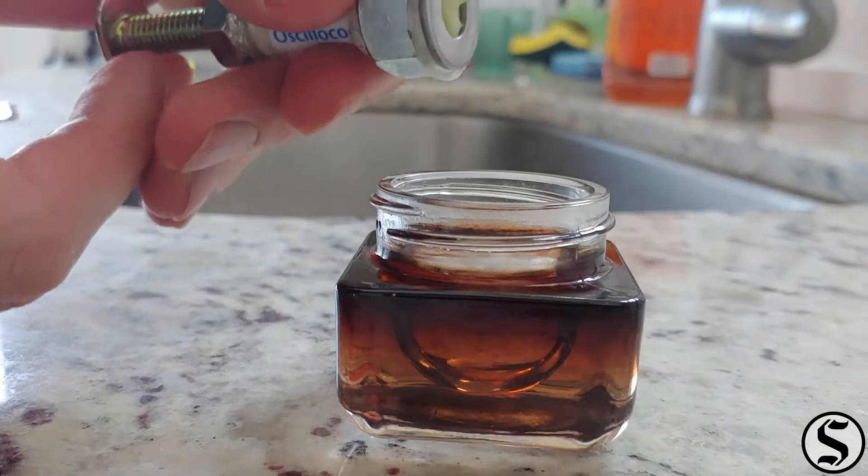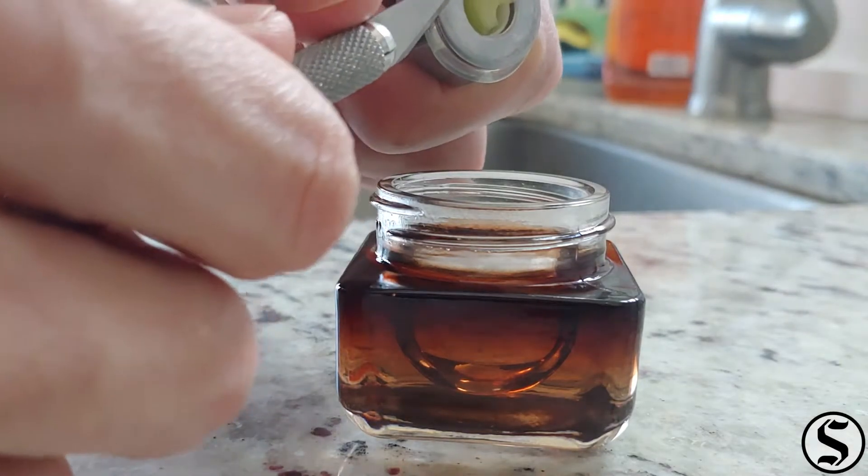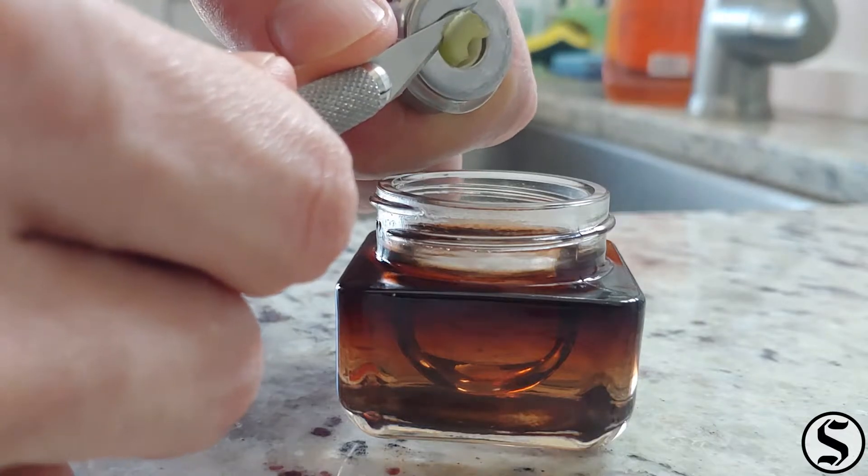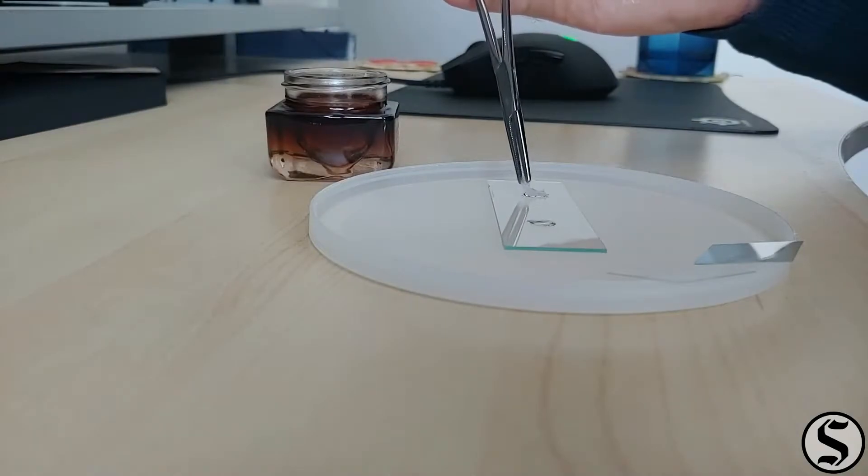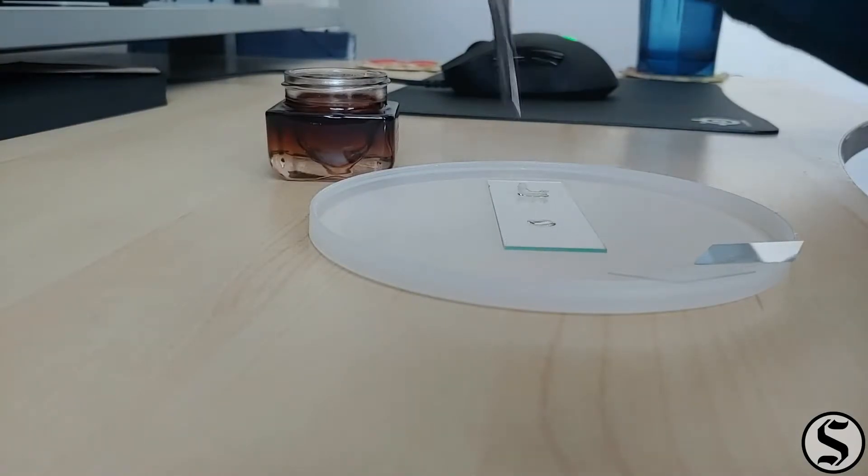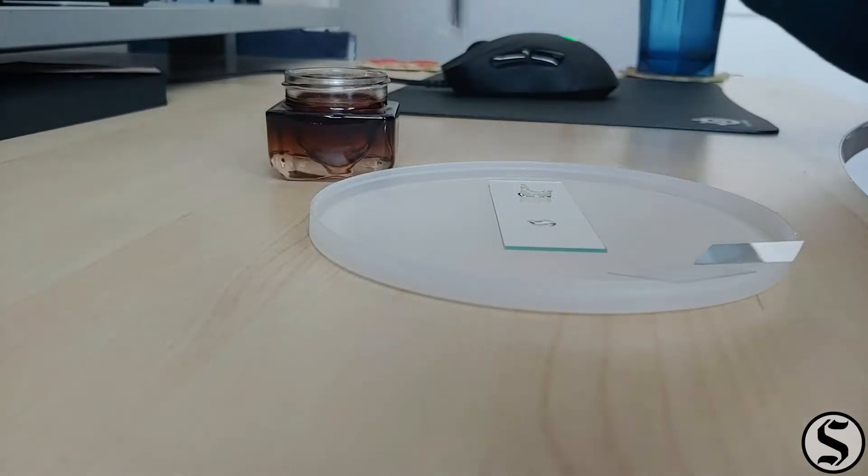I'm just cutting it directly into water this time to keep those pieces hydrated. And I put two slices onto a slide just in case I had any problems with the first one, but the first one ended up working out just fine for us.